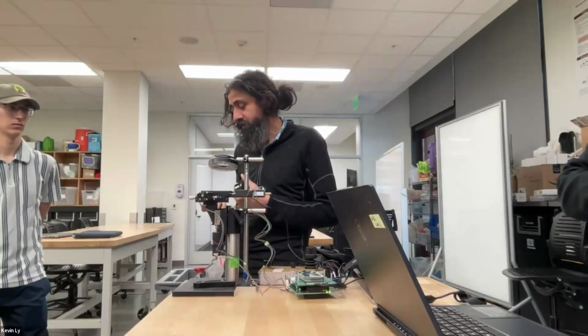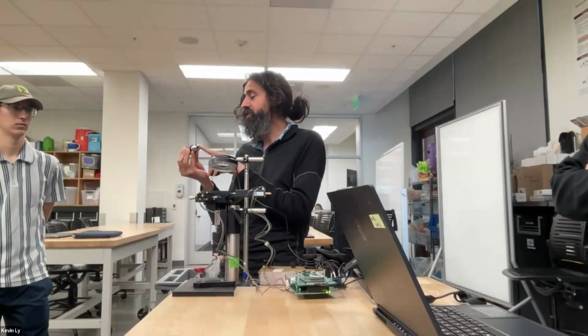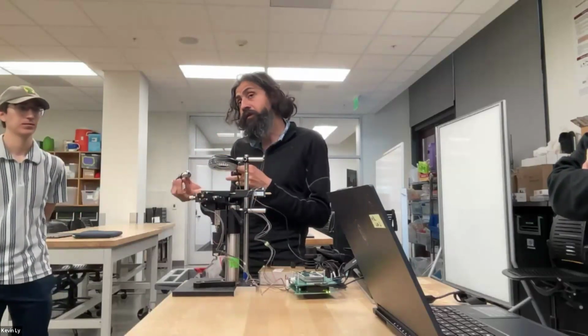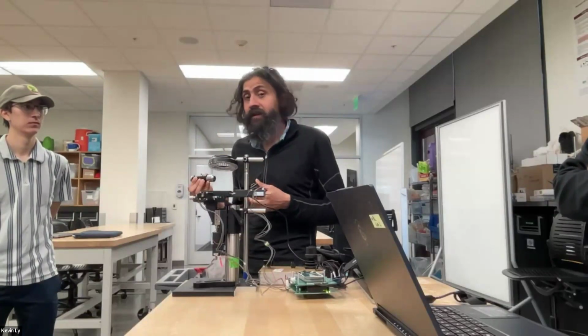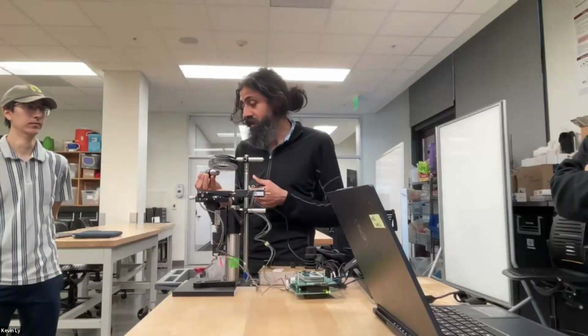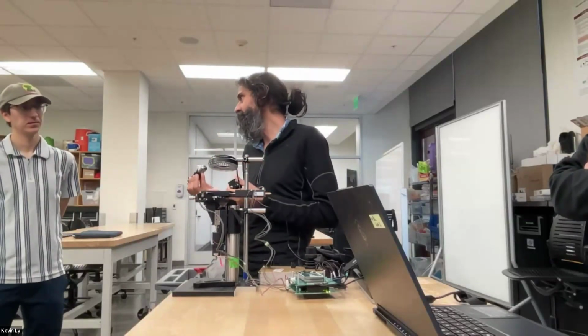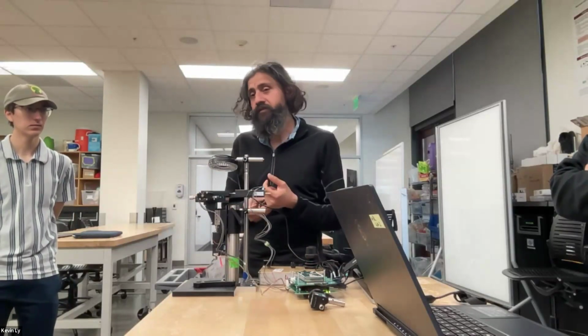Then the other thread is that a common microscope often has an objective. So you have an objective, of course. For Foldscope, we manufactured our own objective. But on the other hand, there are commercial markets around objectives. This happens to be Boli. There are many different objective companies that primarily make objectives. We'll try to open this objective.